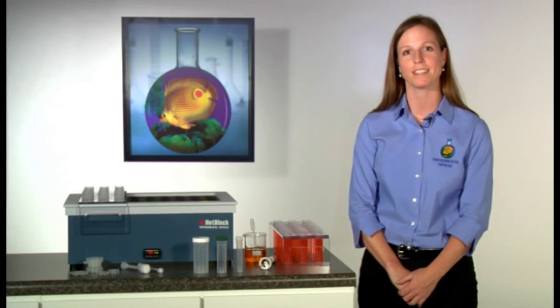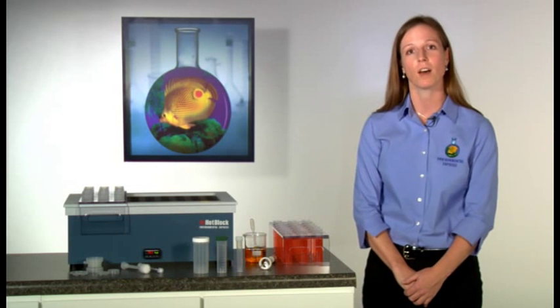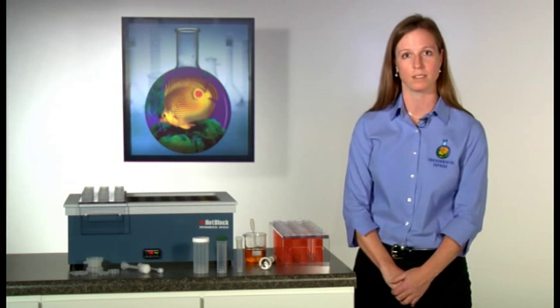Hello and welcome to Environmental Express Tech Tips. My name is Julie and today we're going to be reviewing the use of the hot block for metals digestions.